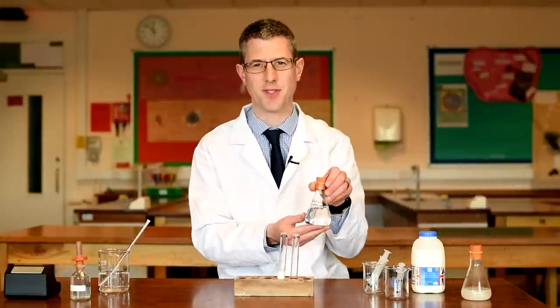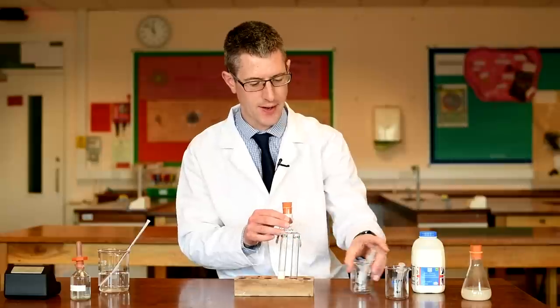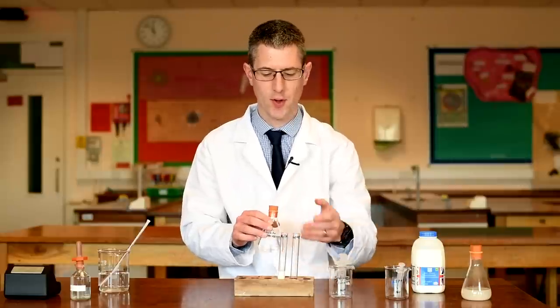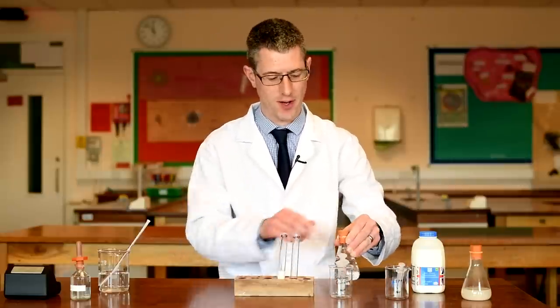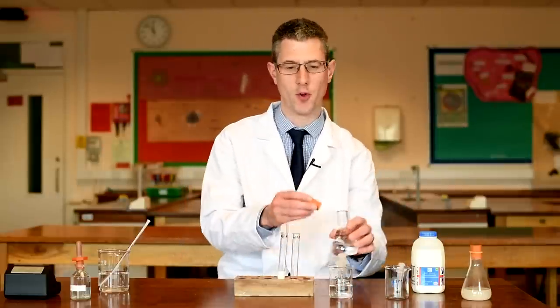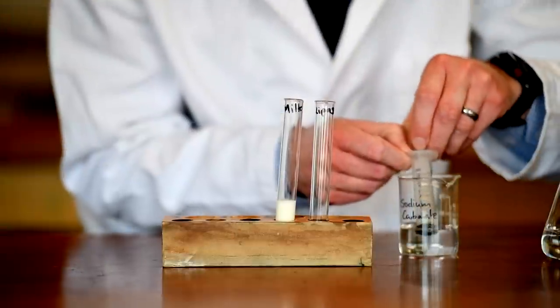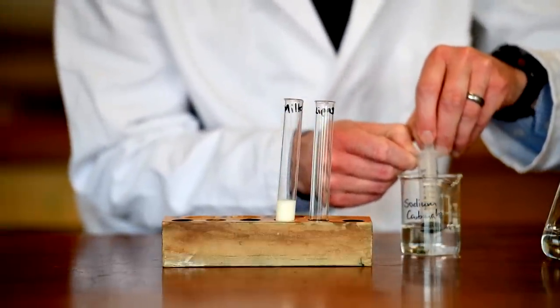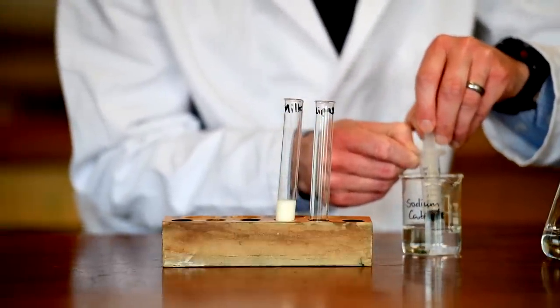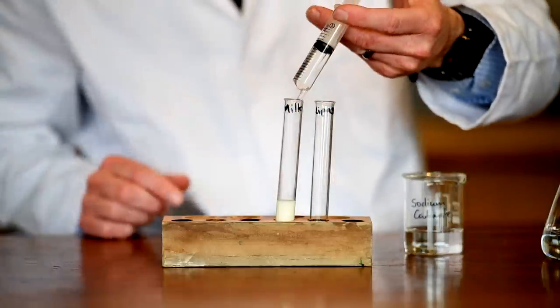We're now going to add some sodium carbonate to it. That is to ensure that the milk solution is alkaline — that's a 0.05 mole solution. Again, measuring out 7 ml as accurately as we can using a syringe, then add that to the milk.